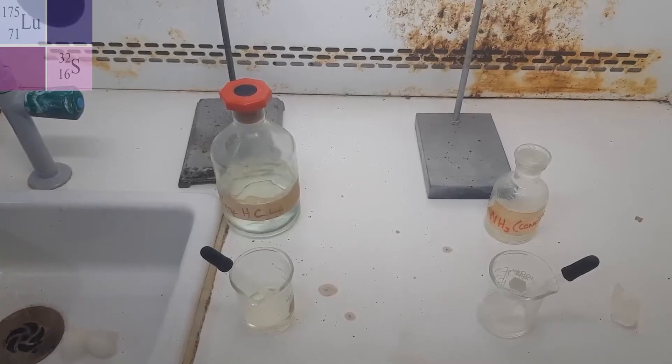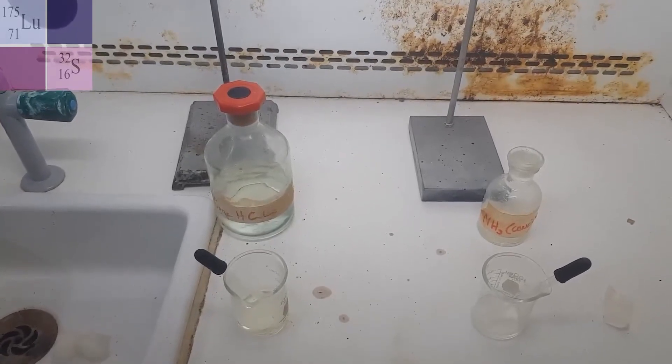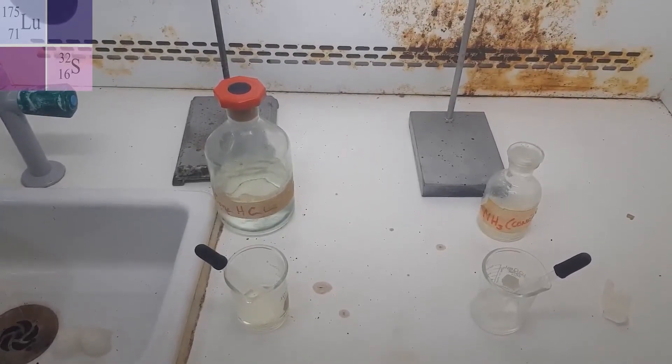All right, so hello everyone, today we're going to look at the rate of diffusion of gases.